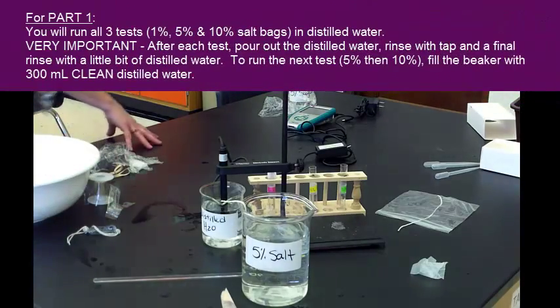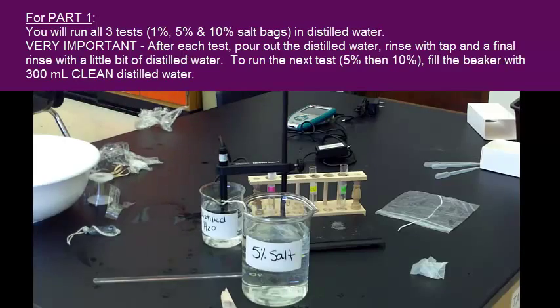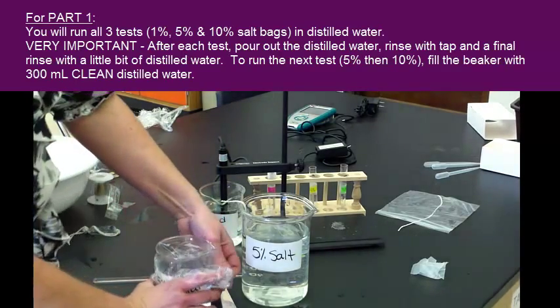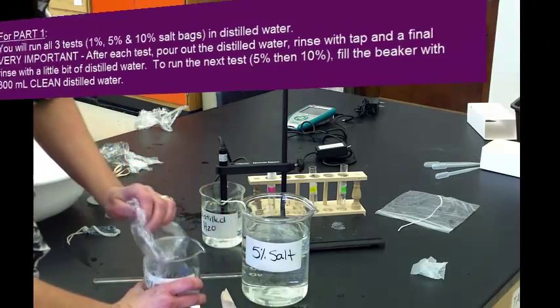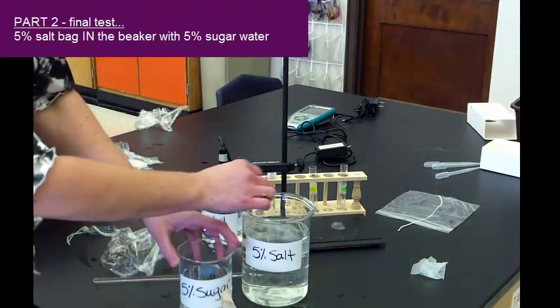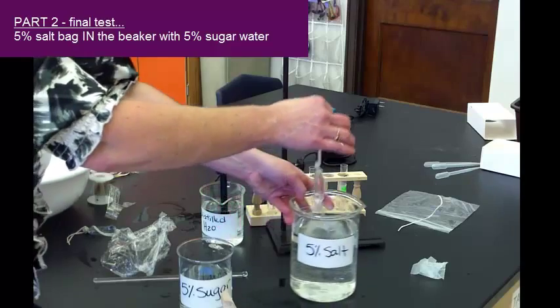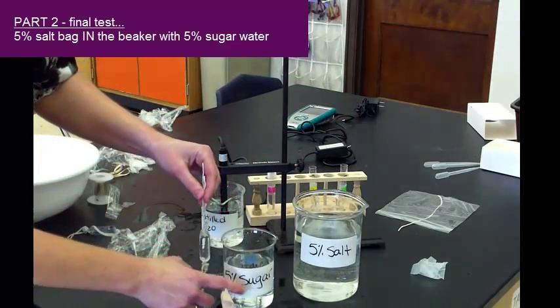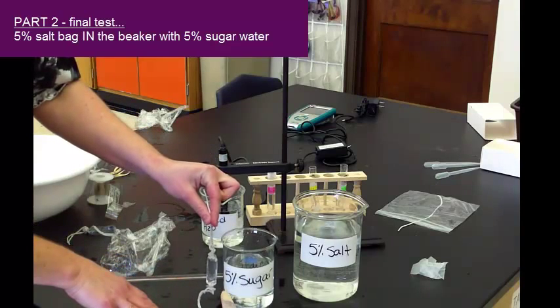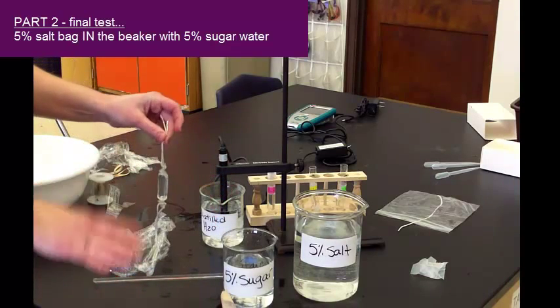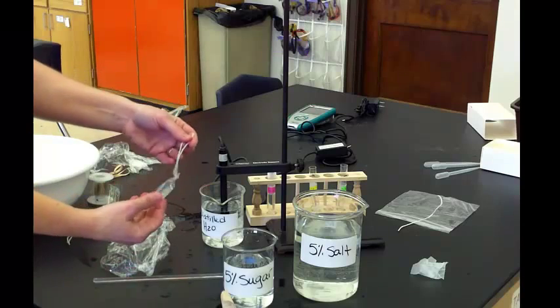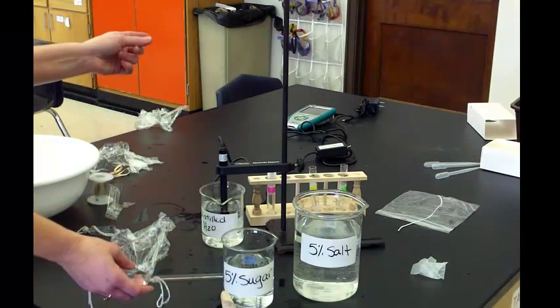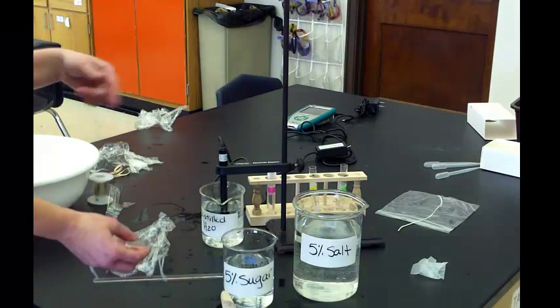So, part 2 deals with sugar. Now, this is confusing. The first three tests is in distilled water. Part 2 is 5% salt in the bag, and then it's going to be in 5% sugar. So, rewatch this. Make sure you know how to tie the bag, and know the order, and make sure you set up the LabQuest, and follow the directions in lab manual.